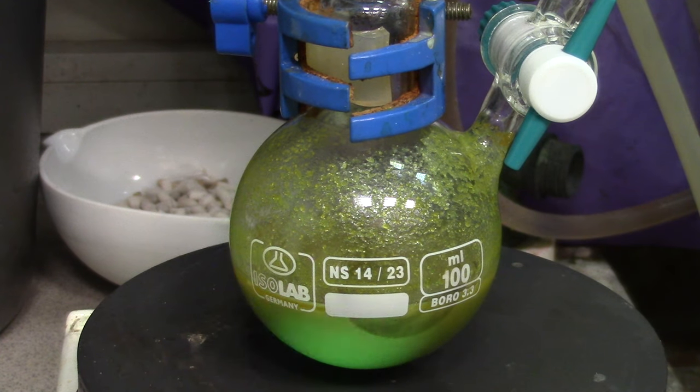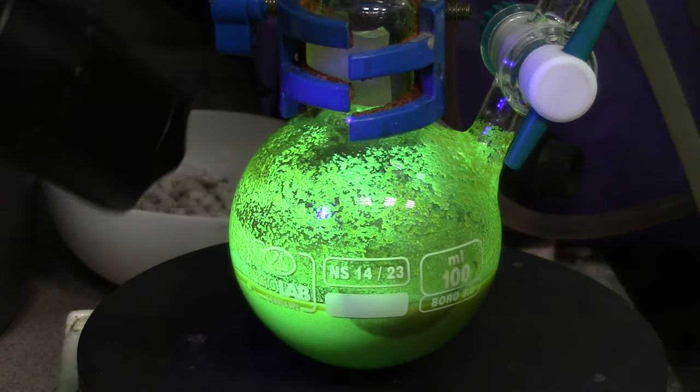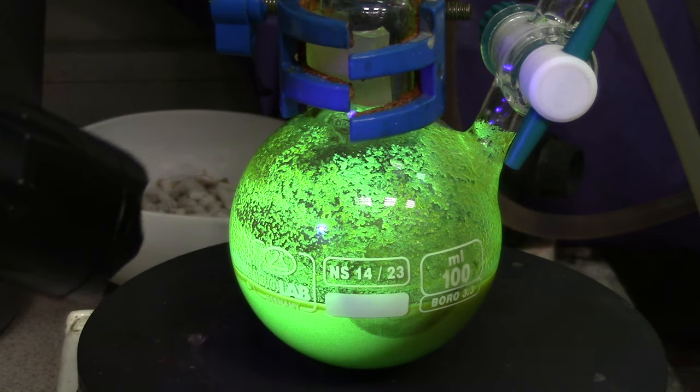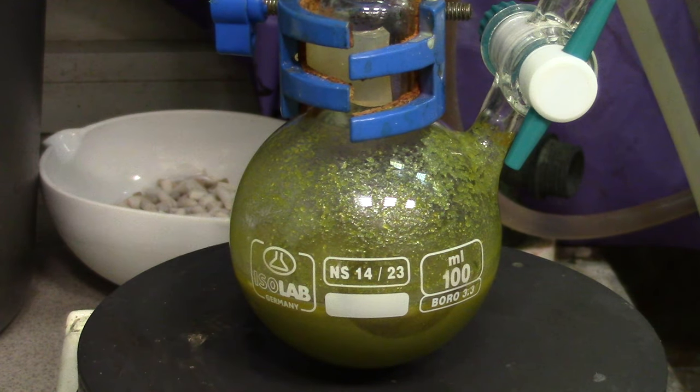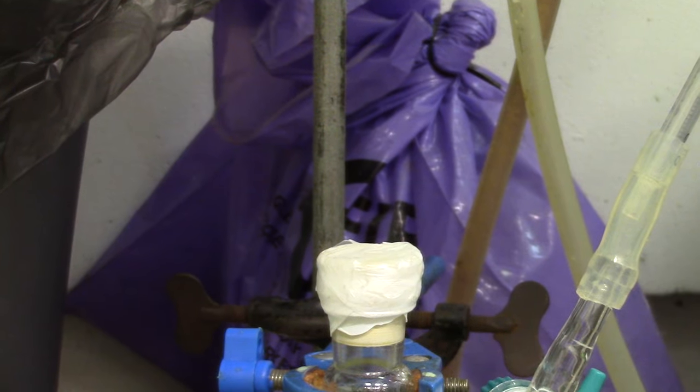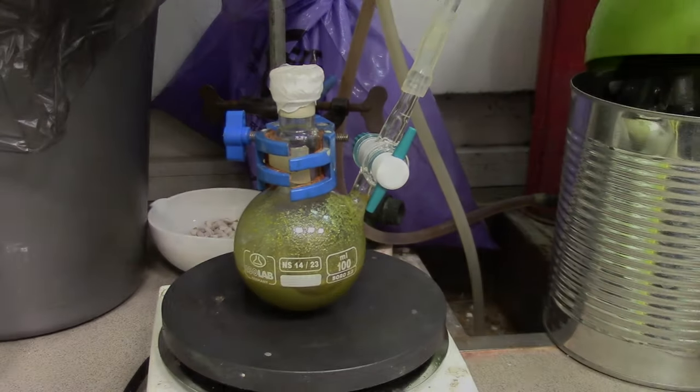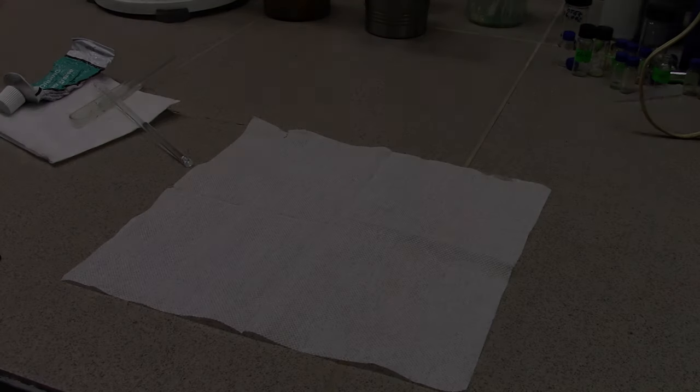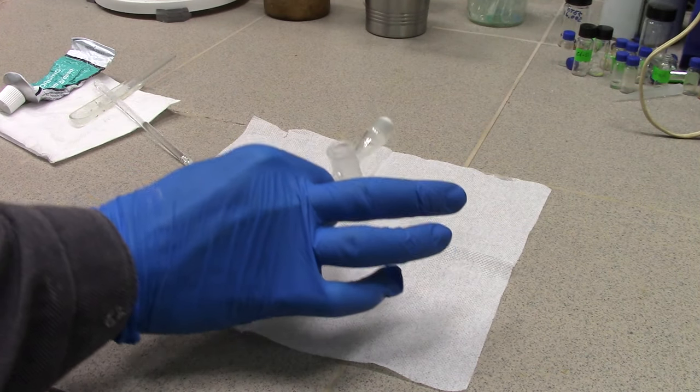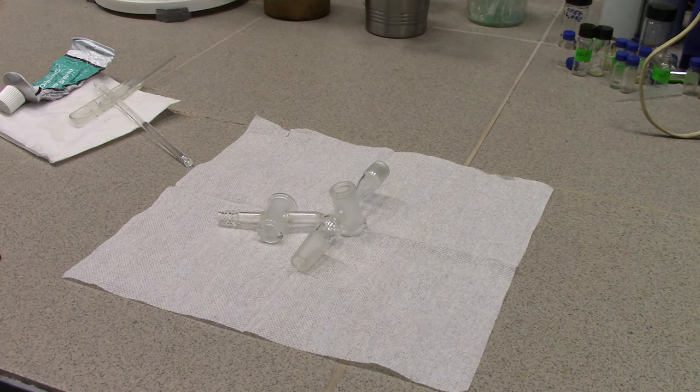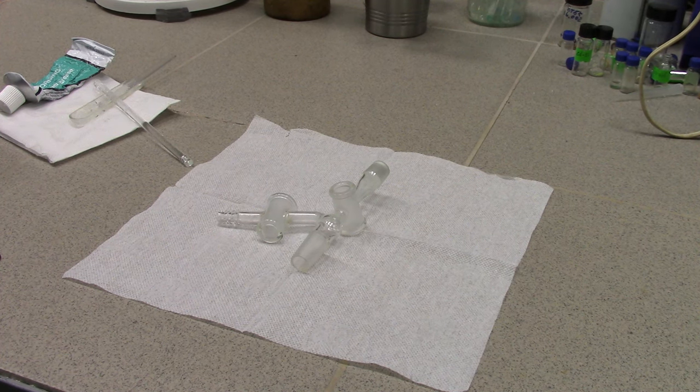Hello my dear chemists, and welcome back to Akanslarex channel. You may remember, but in the video about tetrakis triphenylphosphine, I promised that someday I would make a guide about filtration of this catalyst under inert atmosphere. So here it is. Today I'm going to talk about it in an instructional manner and show you some useful tips.